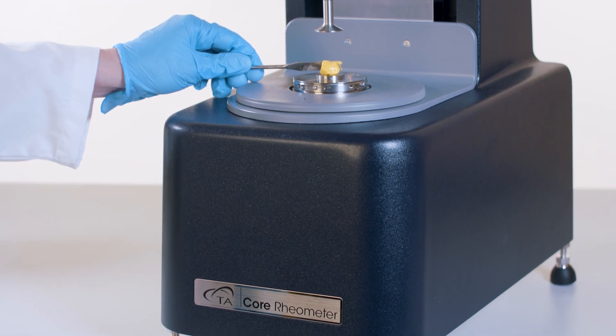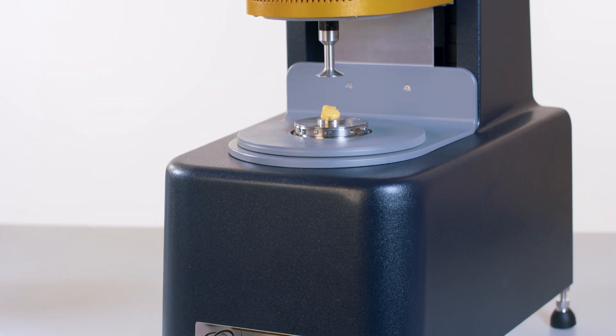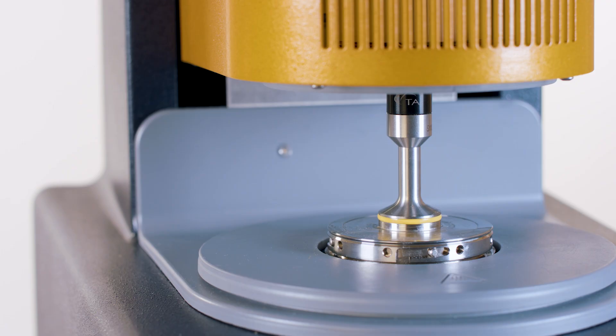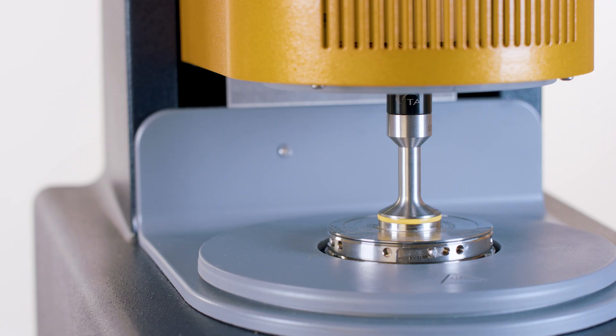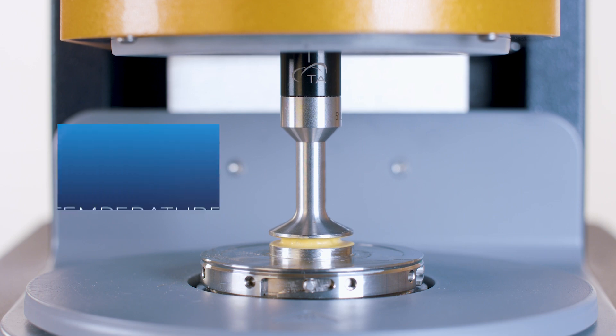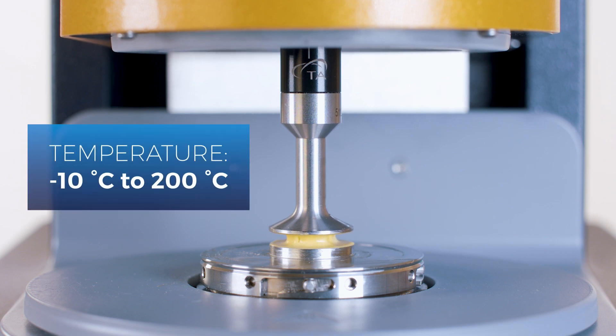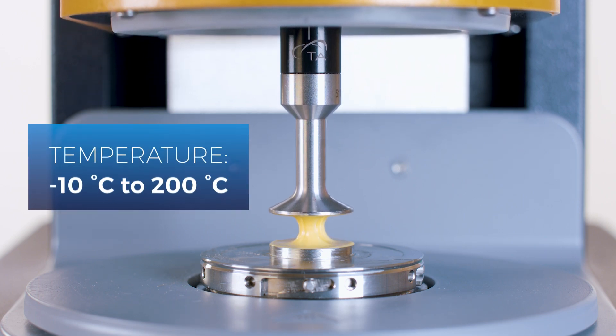The DCR goes beyond viscosity measurements, characterizing complex viscoelastic behavior and controlling sample temperature using rapid, precise Peltier technology.